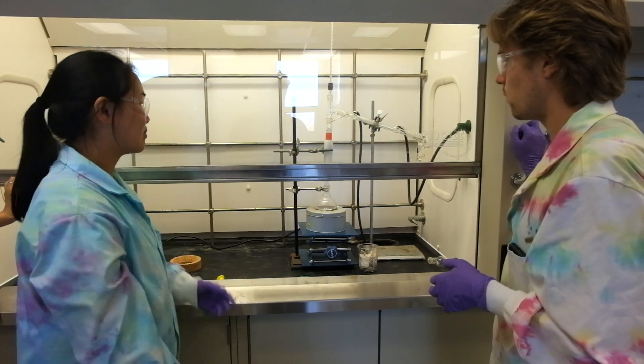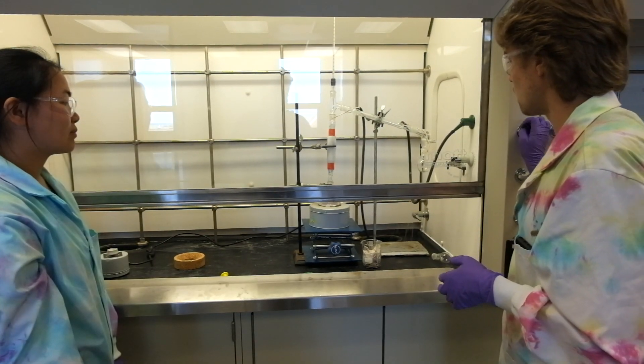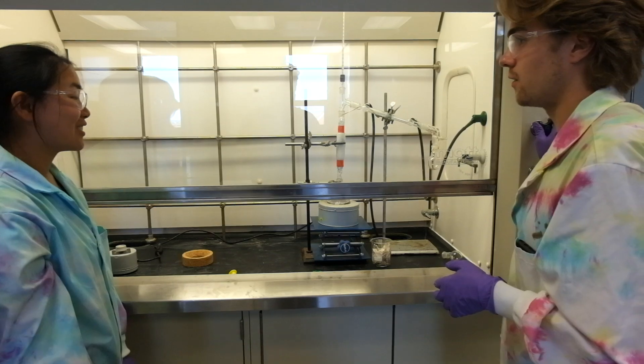Before we get started, we're going to turn on the cold water.